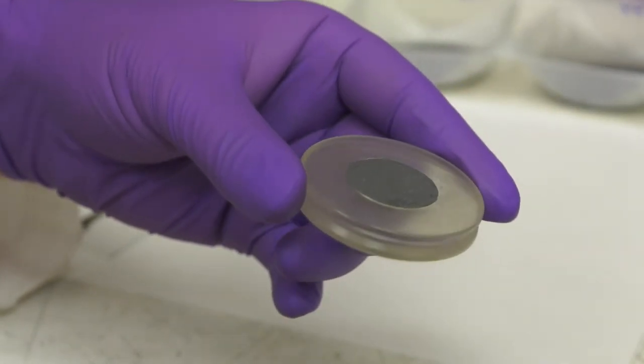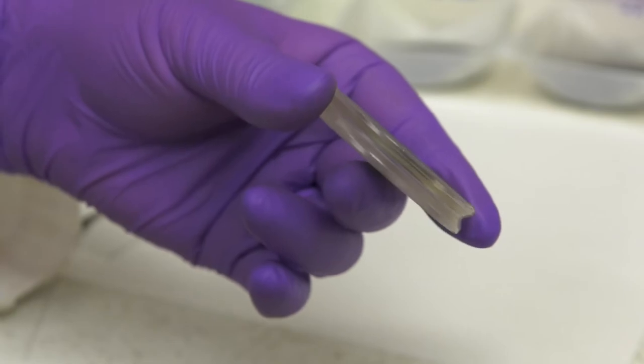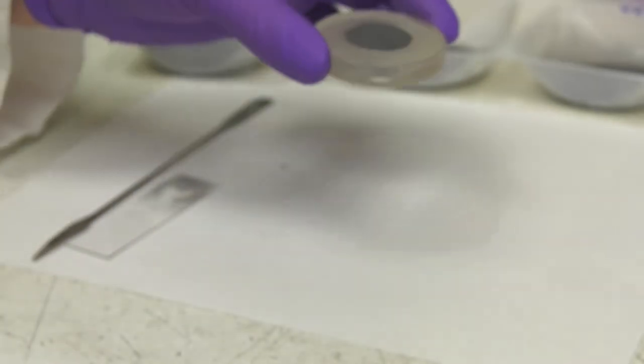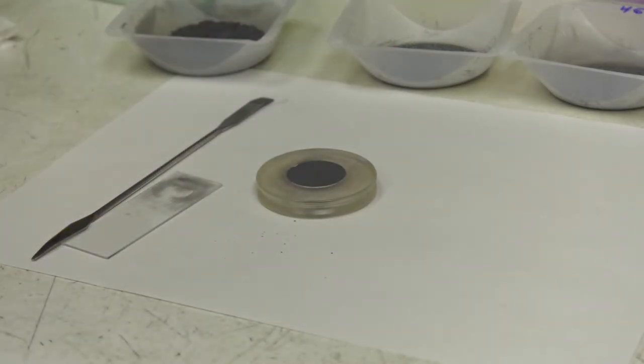This powder sample is ready to be placed into the XRD and measured. The process is repeated for other powders of different sizes.